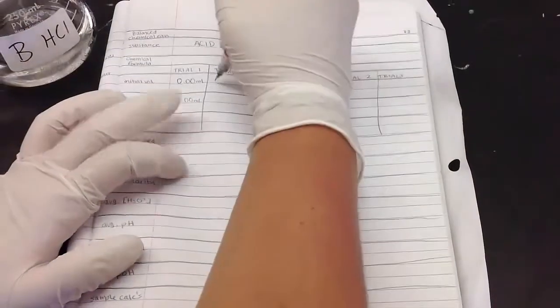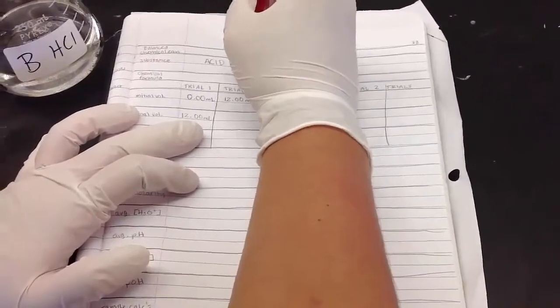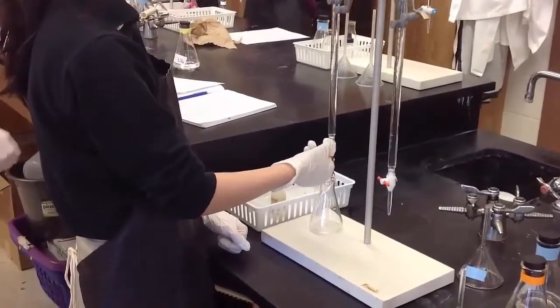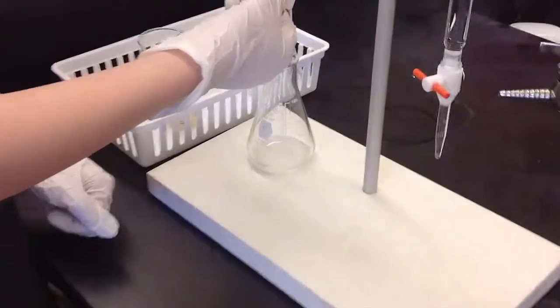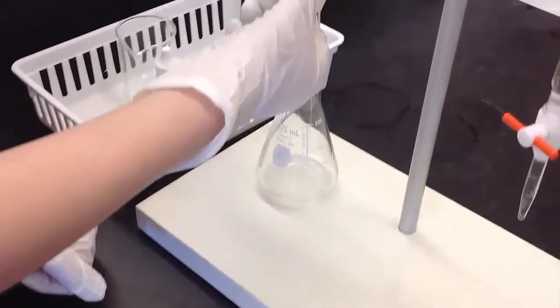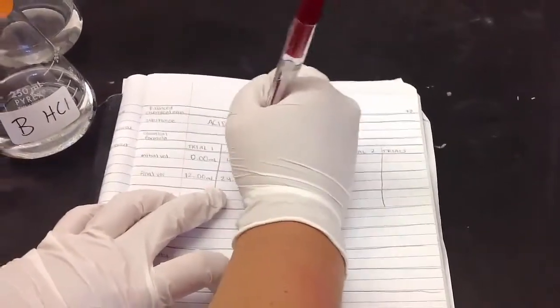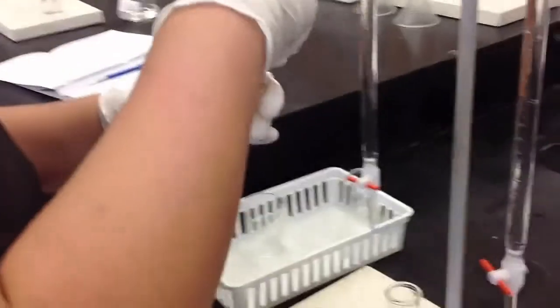The volume of the acid in the burette was rounded to the nearest 0.01 milliliter and recorded as the initial volume. Around 12 milliliters of acid was released into the clean Erlenmeyer flask. The initial volume reading was subtracted from the final reading, and this is the exact volume of acid released into the flask. This was recorded to the nearest 0.01 milliliters. 3 drops of the appropriate indicator, phenolphthalein, were added to the flask.